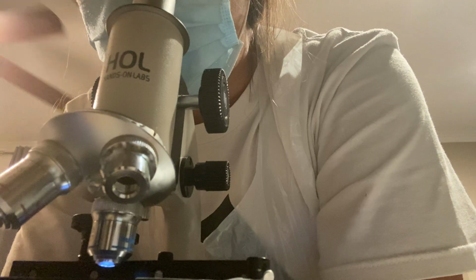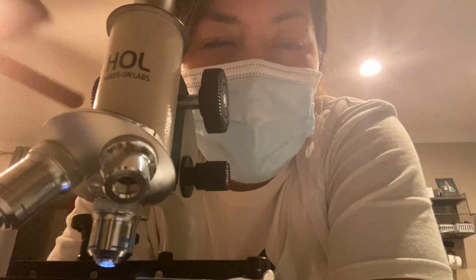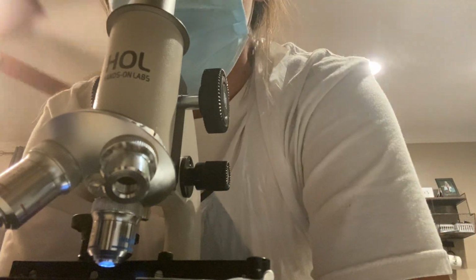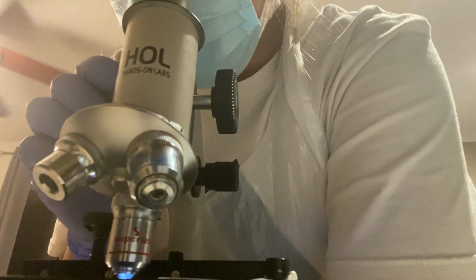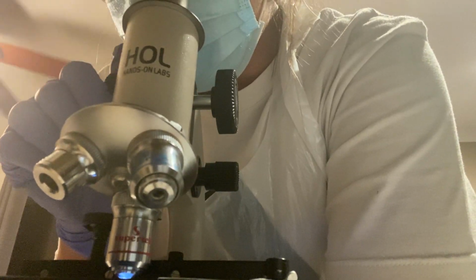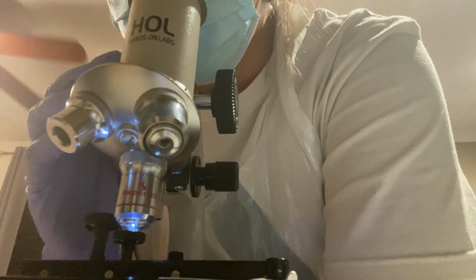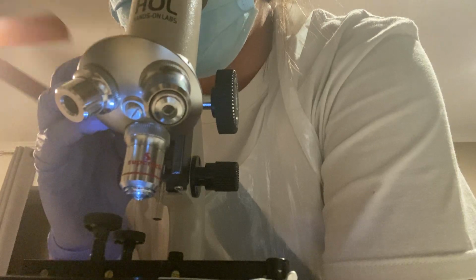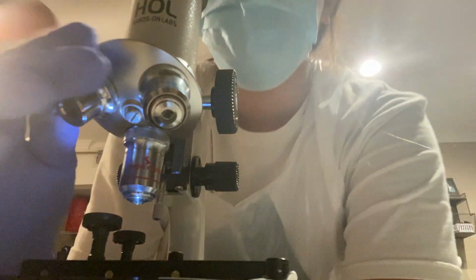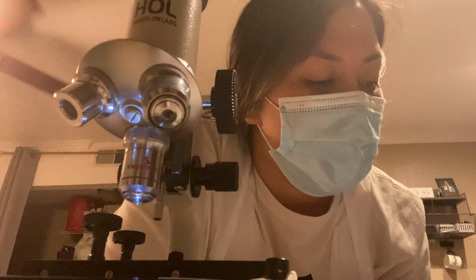Some actually appear darker than others, which I'll show in the uploaded photo. I don't know if that's from the staining or not, but there are some parts of this that are darker than others. I'm going to switch over to the high power just to see what it does. I'm not seeing anything. I think it might be too strong. Yeah, so I think the medium power worked best for the E. coli slide, so I'll upload a picture of what I saw with that.